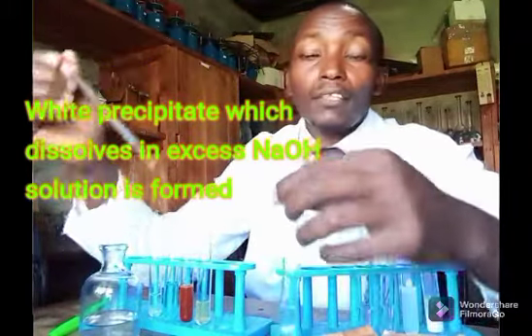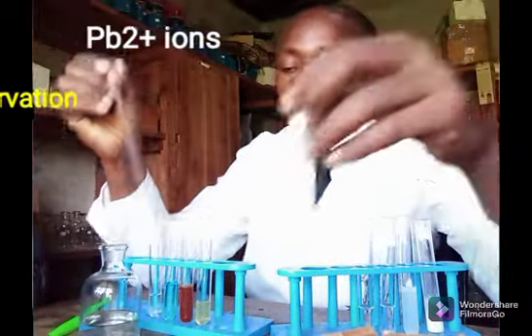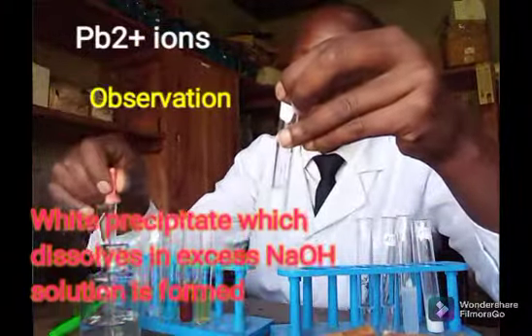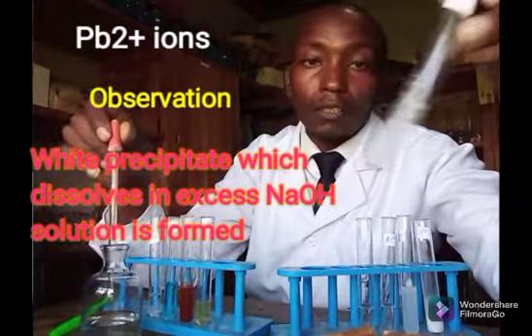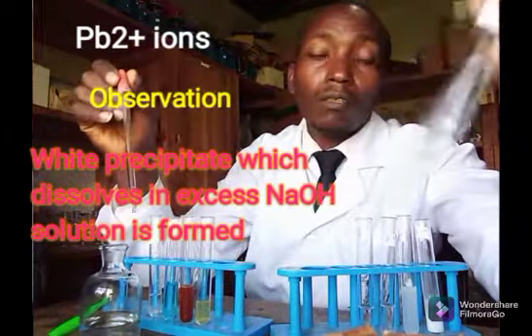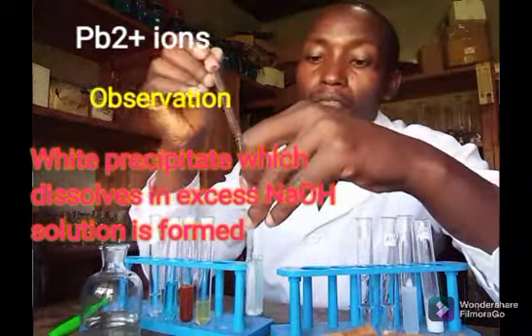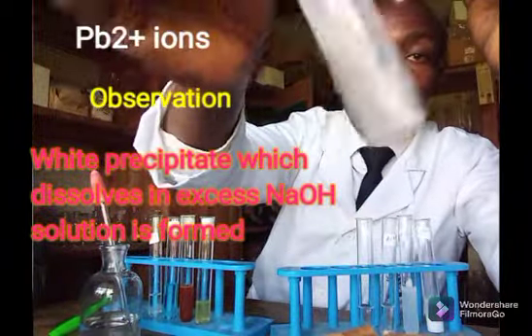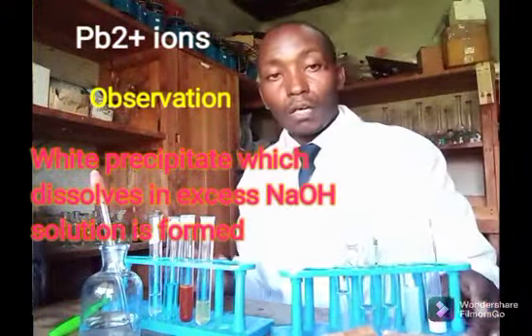The next one has lead-2 ions. You can see a white precipitate, very clear white precipitate. I can put excess. I add excess of it. You can see what is happening to the white precipitate. Yeah, good. The white precipitate has dissolved. When I add excess of sodium hydroxide, the white precipitate has dissolved. That is with the lead-2 ions.